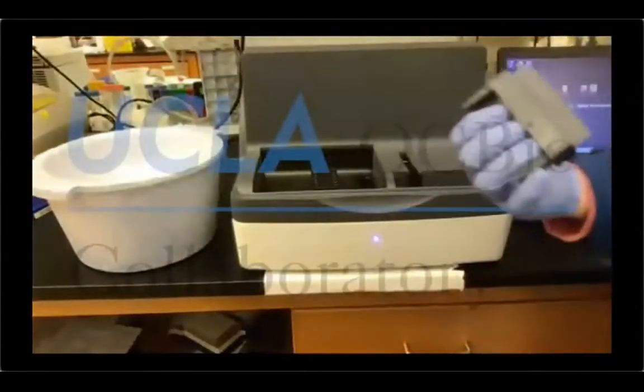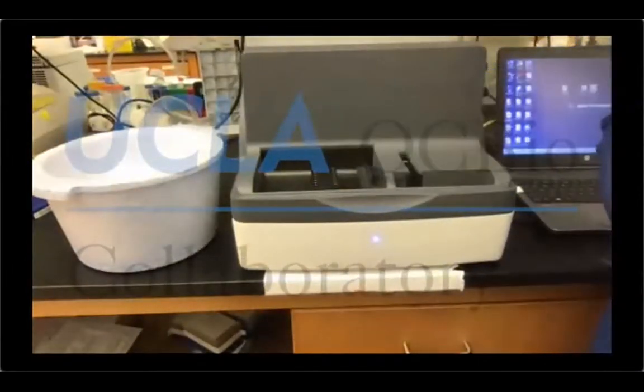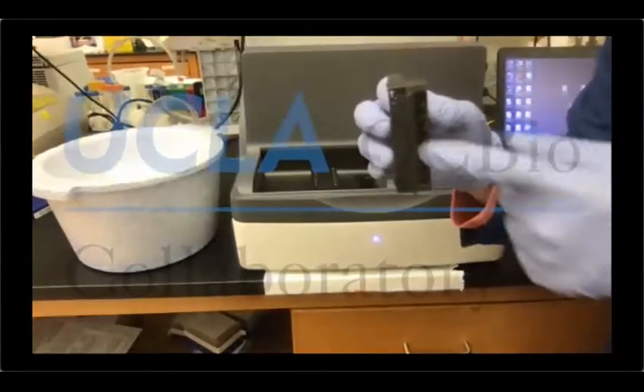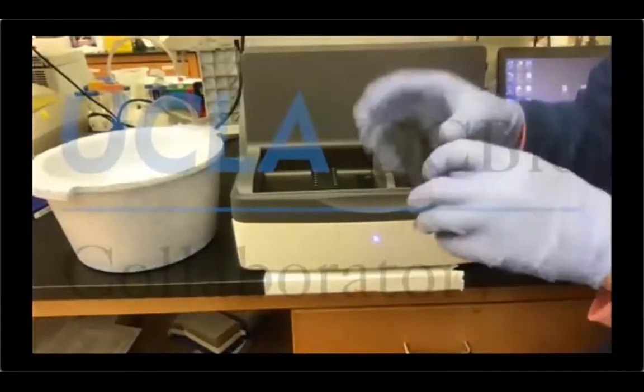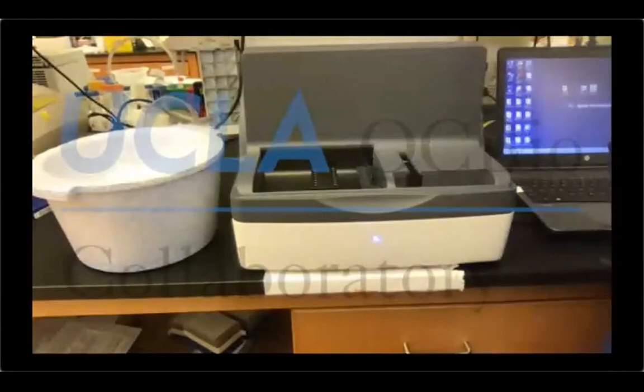I'm just going to empty this one, and that's it. It's all clean, okay? So no samples in the sample slot, no tips whatsoever, anywhere, unused, used. Just make sure, because sometimes they get stuck. And then the screen tape port is empty. So we just close it, and then the next user will be good to go.